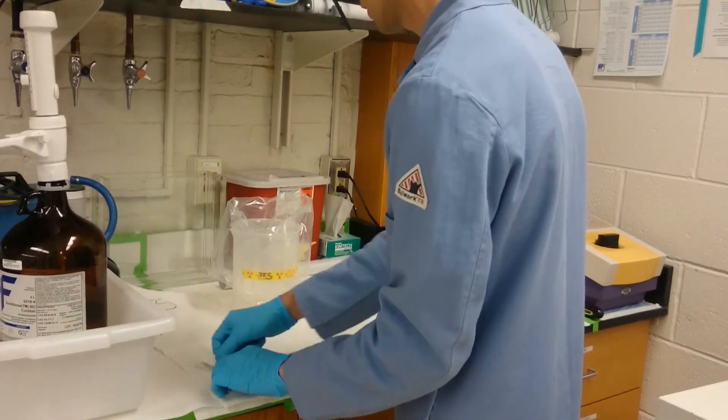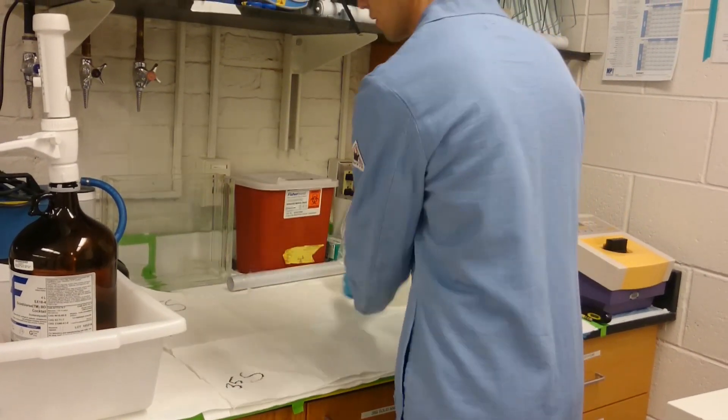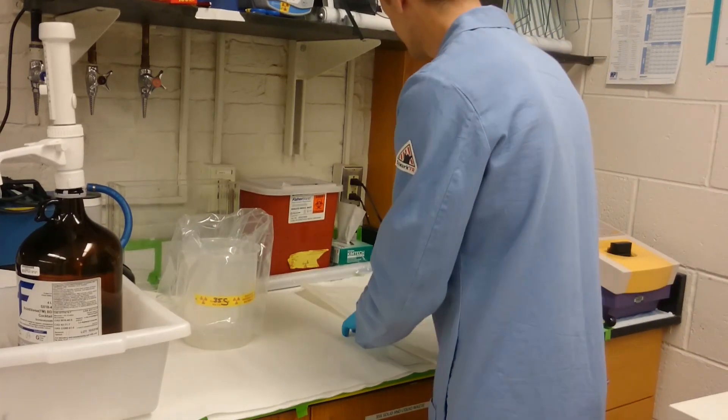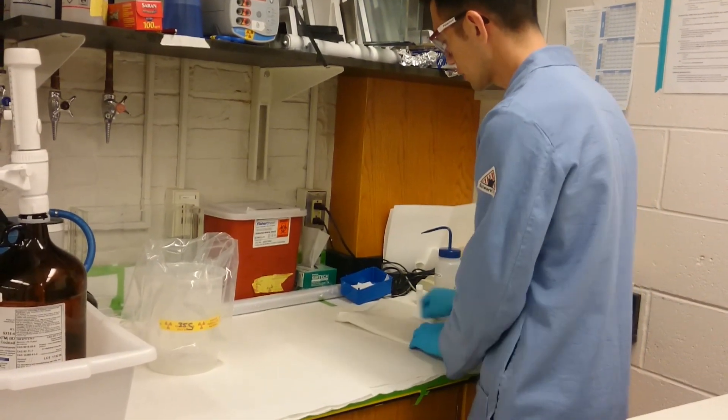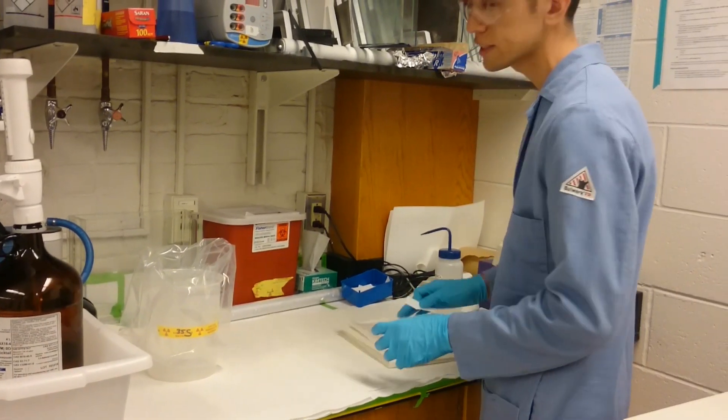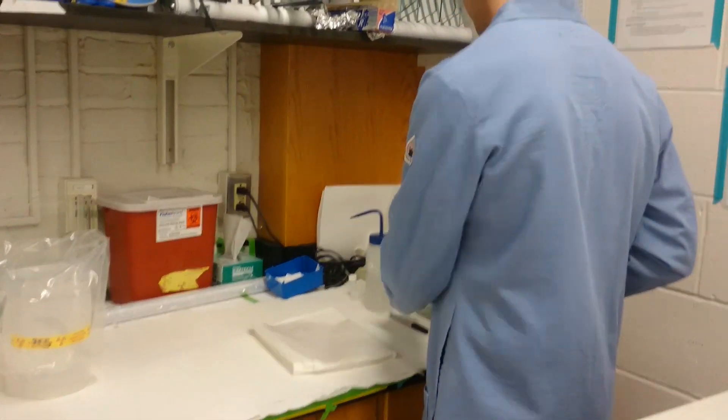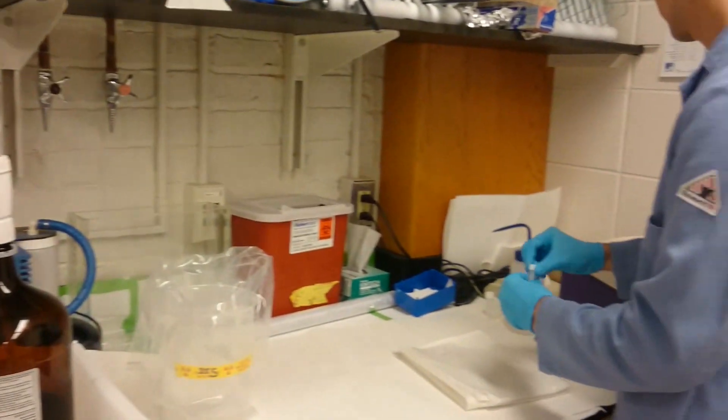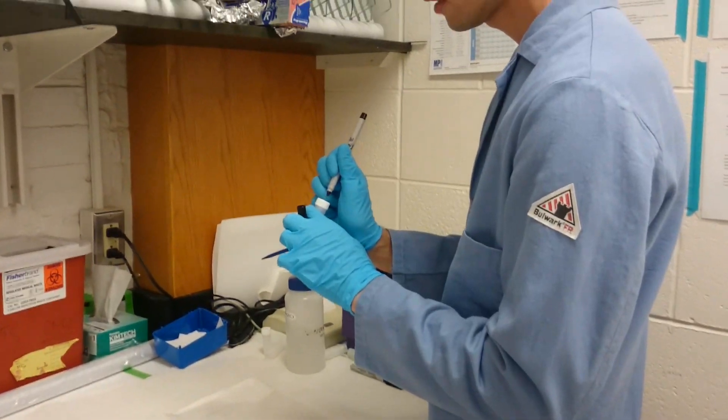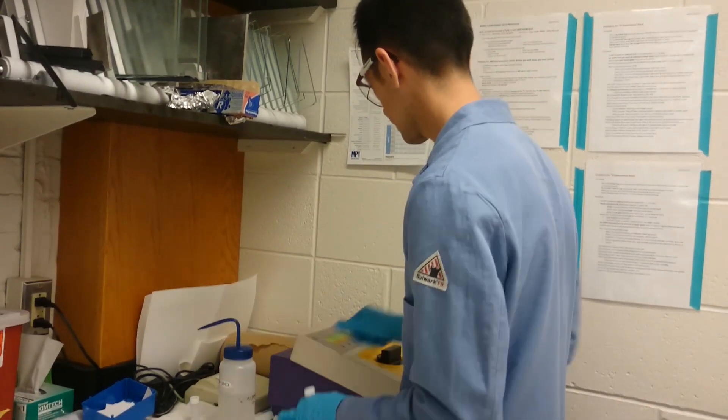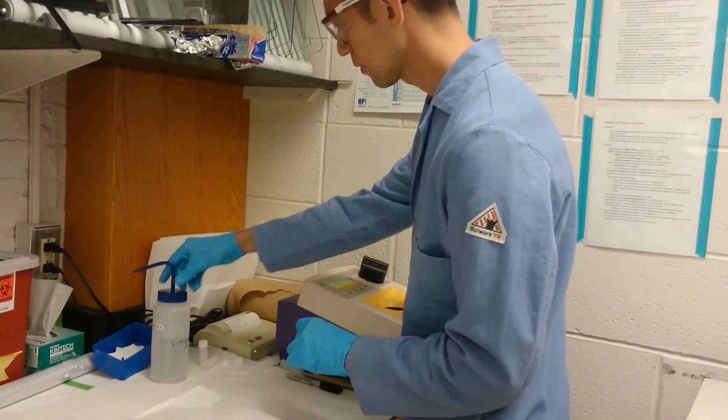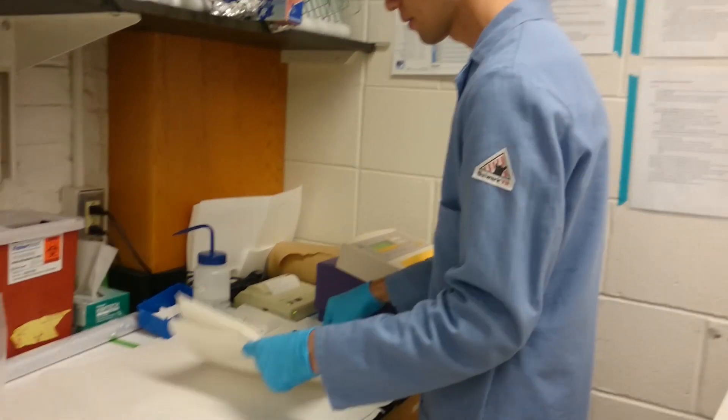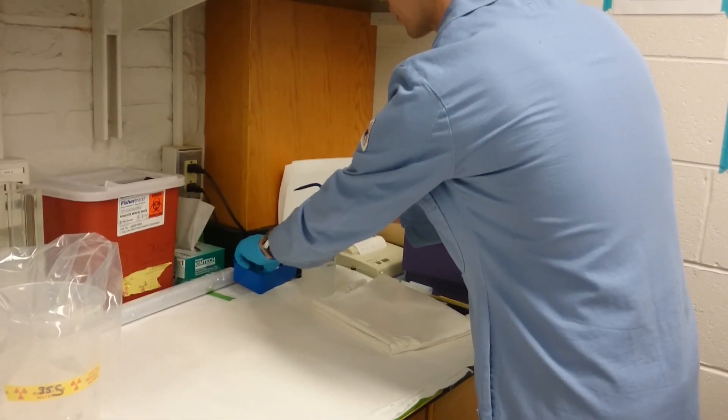I'm going to start by swiping the work side of the paper, the back side, the other back side, this part, this one. So in the process, I've swiped the entire surface of this.